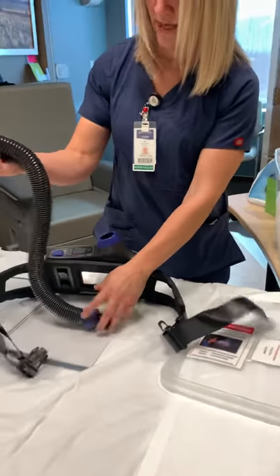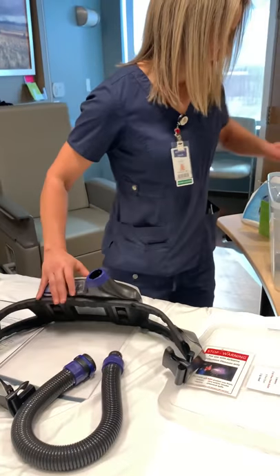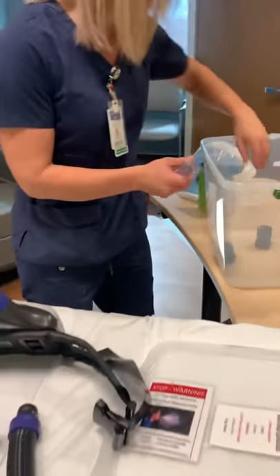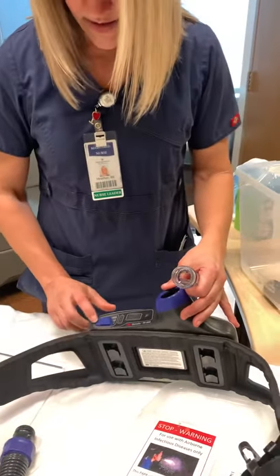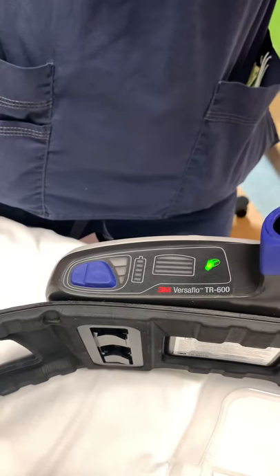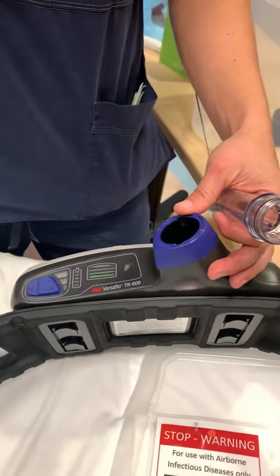You're going to check your tubing to make sure there are no cracks or damage. Then you're going to hook up the airflow test to your PAPR. To turn the PAPR on, you're going to hit the power button and you can hear it starting to generate the fan.